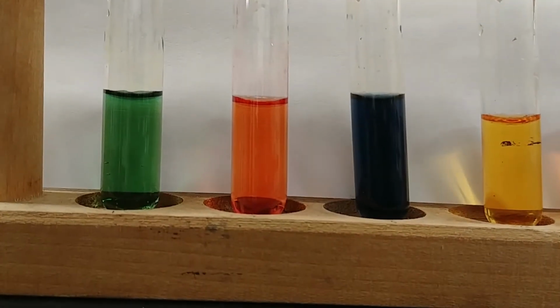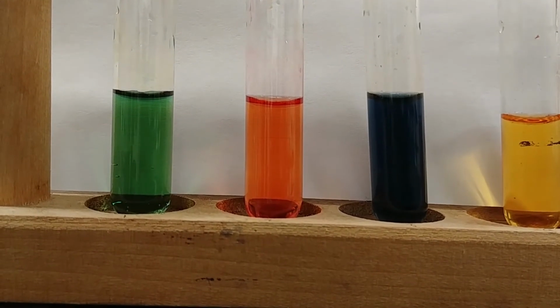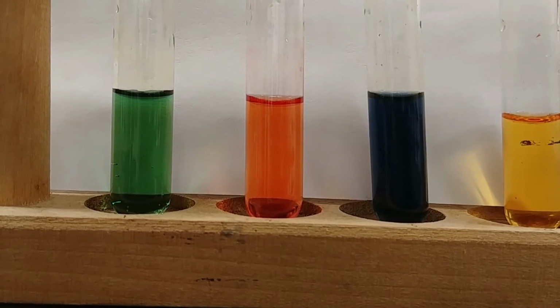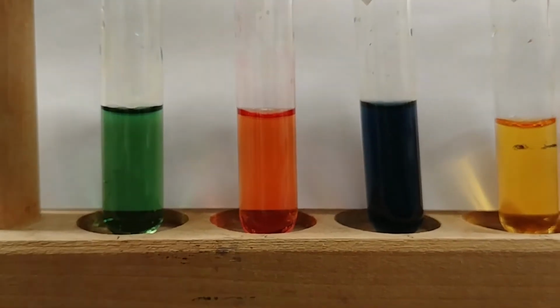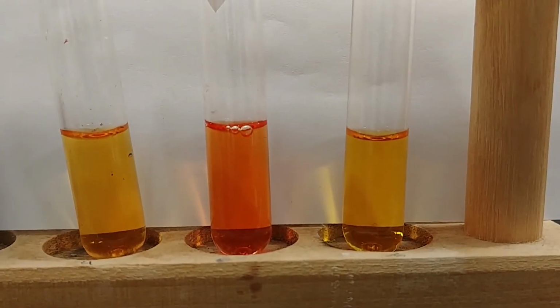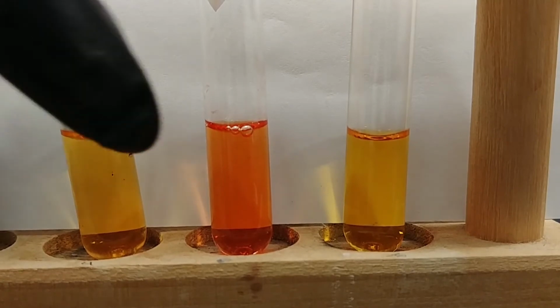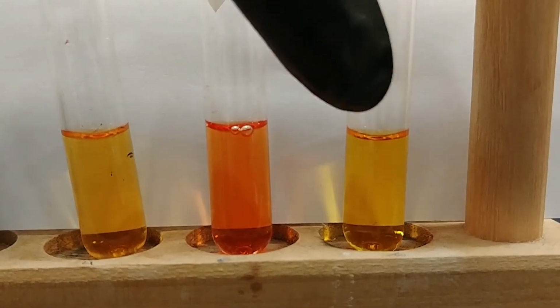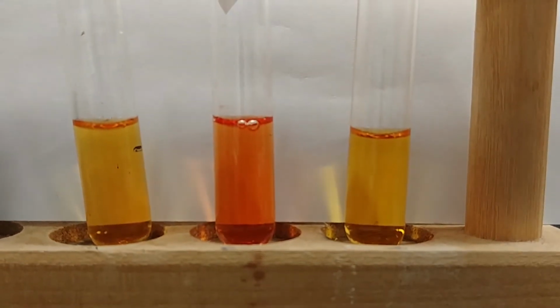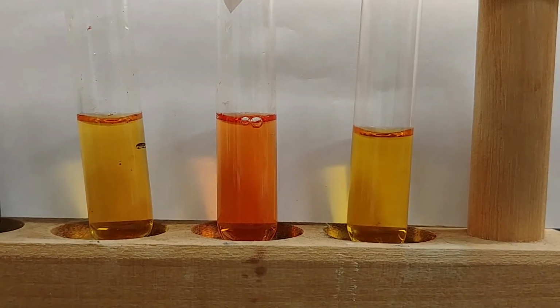So if we pan back to our water samples, think about the difference in pH that we saw here when we added just a single drop of acid or base, based off of the initial solution that we had. And then compare that to our buffer solution. This is our original buffer solution. This is adding a single drop of our acid, and this is a single drop of our base. Let's try this with our second buffer as well.